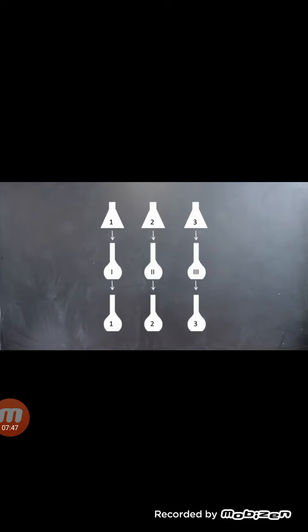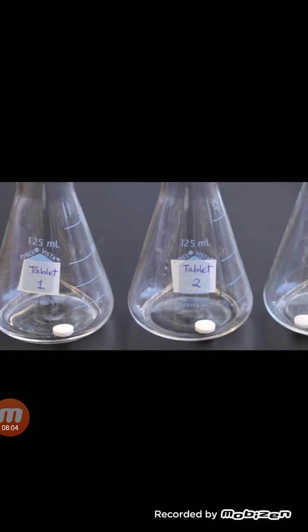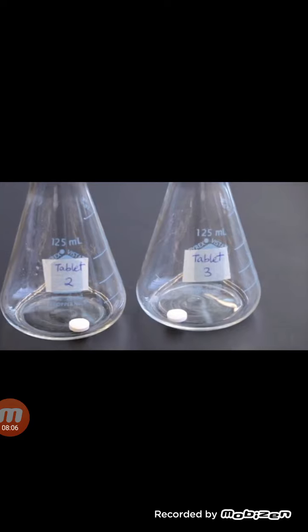In the second part of this experiment, you will hydrolyze 3 aspirin tablets and dissolve each sample in a 100 ml solution. Each solution will then be diluted again, and these solutions will be analyzed using the Spec 20. Begin by accurately weighing by difference 3 aspirin tablets. This is the equipment you should bring with you to the analytical balance room.